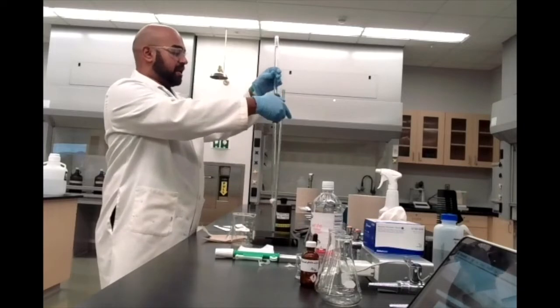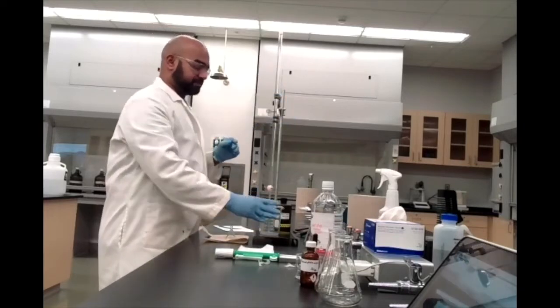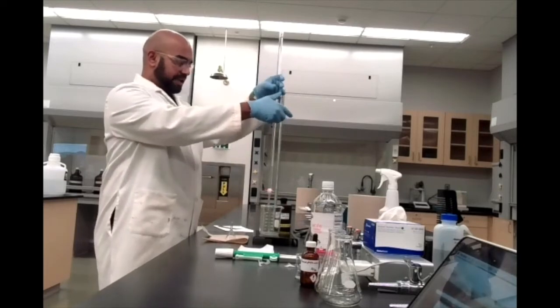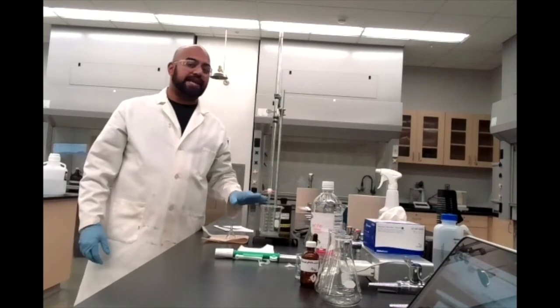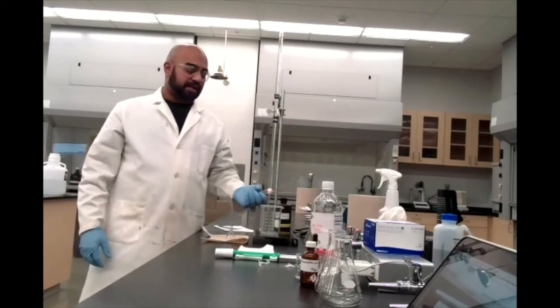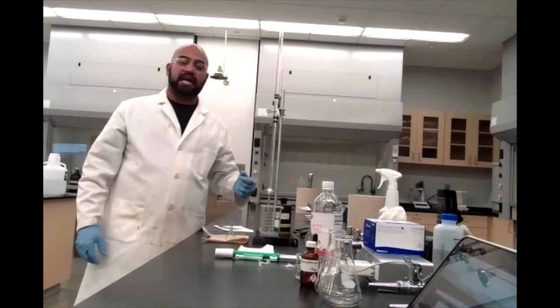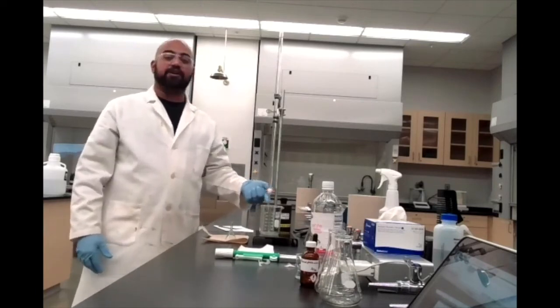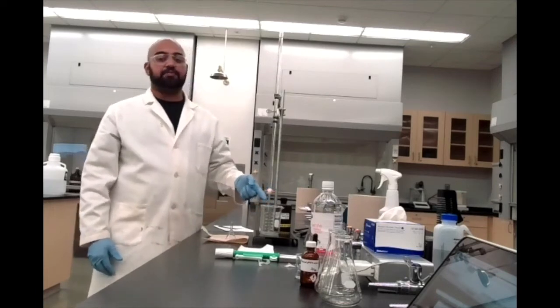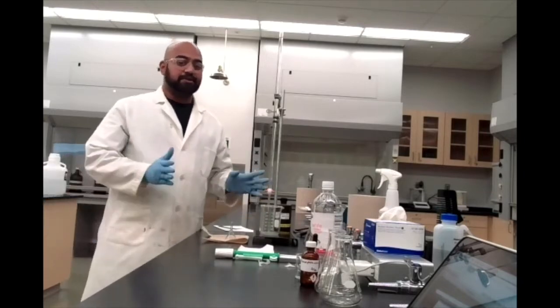So here's a beaker I'm just going to use for waste. Let's lift this up so I have room to put the beaker in there. I'm just going to lower this down a little bit. I don't like to lower my burette too close to any container that's underneath it, just in case anything splashes back onto the burette and might contaminate future results. Any sodium hydroxide that winds up sticking to the outside of the burette might drip into an Erlenmeyer later on when I'm doing my experiment. So be careful of that.